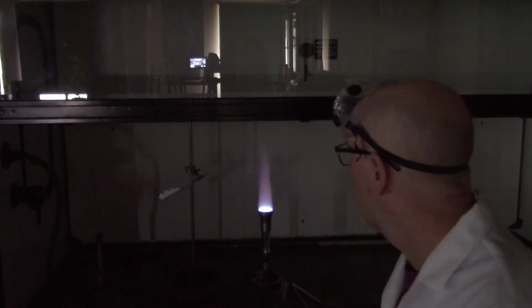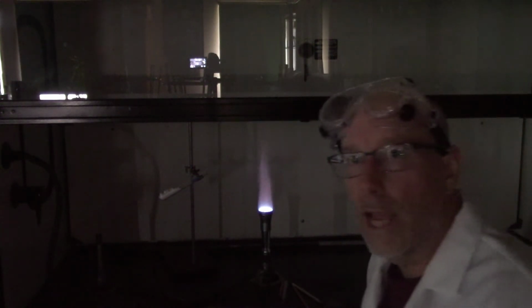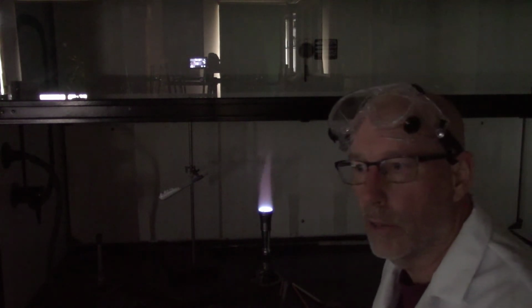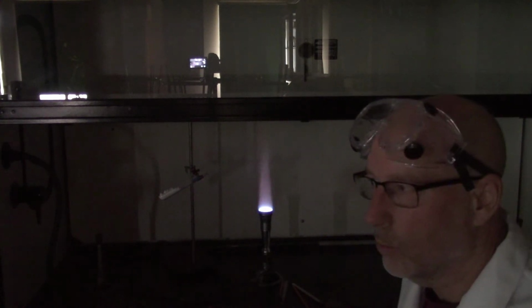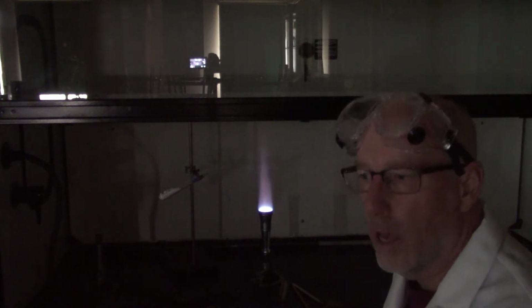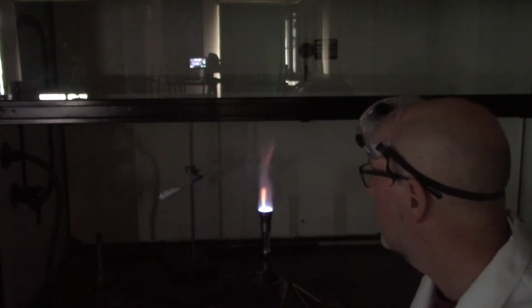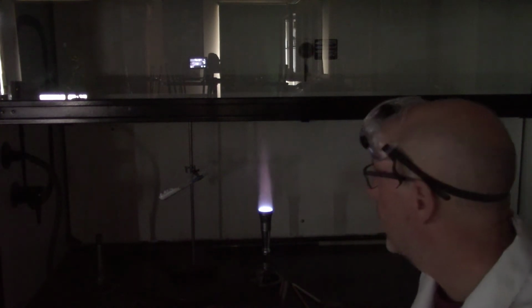The first chemical reaction we're going to take a look at is one that you've seen a million times before. It's burning gas. The gas that comes through the tube there is called natural gas. Natural gas means it came out of the ground not too long ago, and they haven't purified it terribly well. They could purify it into separate things like just methane, just ethane, just propane. Propane gas is more pure than this. This is natural gas. It's a mixture of mostly methane gas and propane gas.